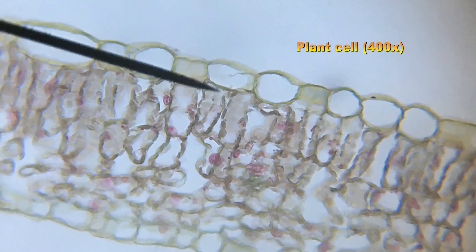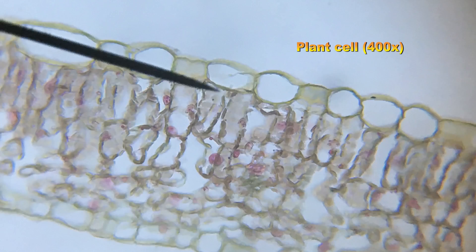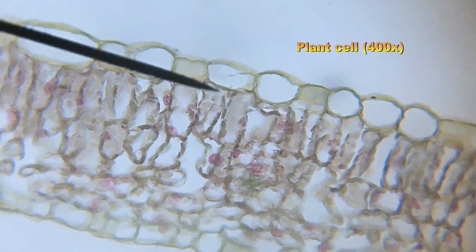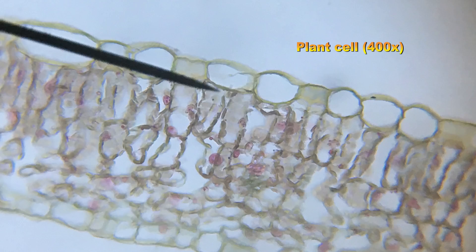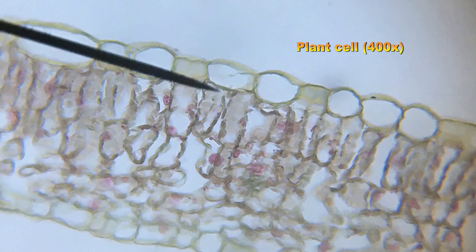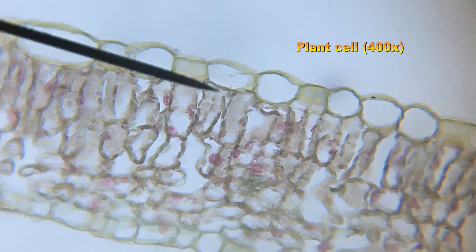Here's a still photo of that same video. The cells second from the top, very rectangular in shape, are the ones you'll want to label.